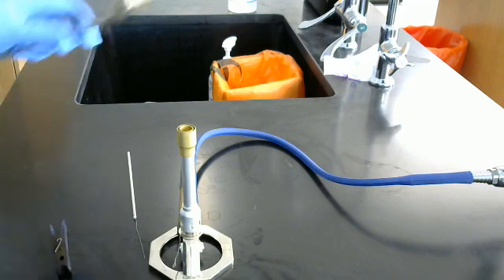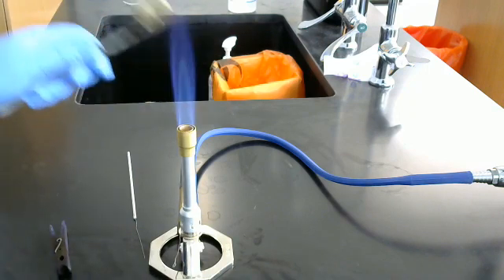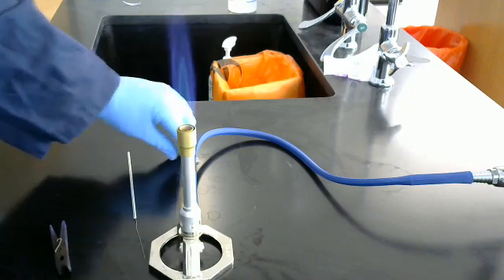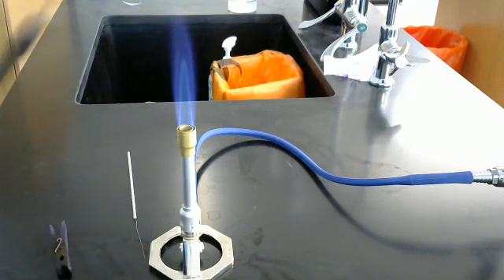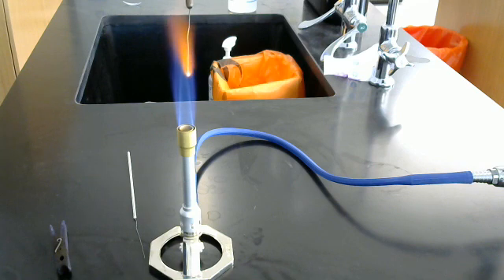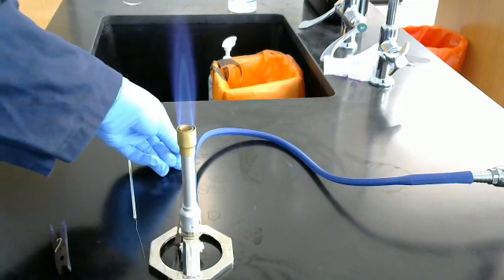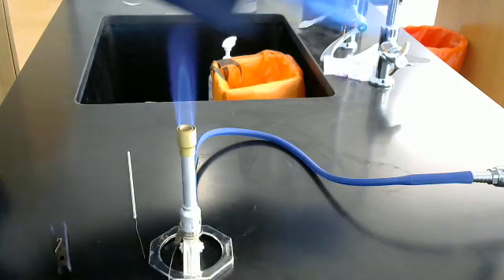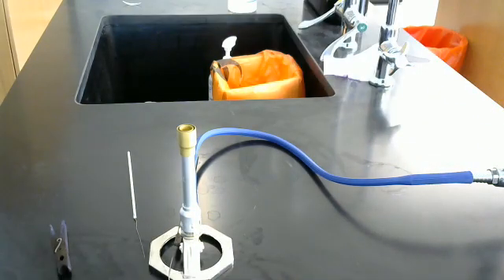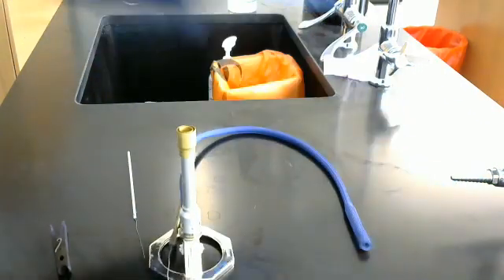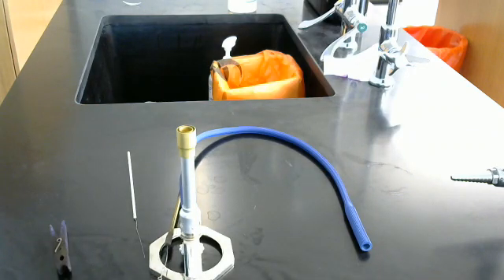Now, same as before, aseptic technique, so we're going to light the fire, take our loop, sterilize it, and then we're going to turn off the gas, unplug this, and we're going to go back to the prep itself.